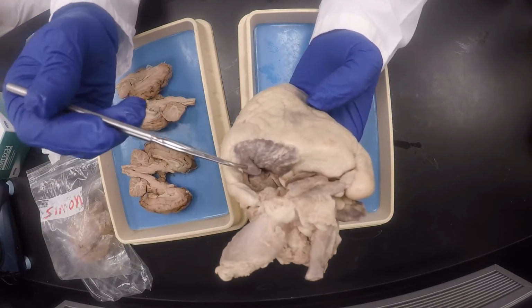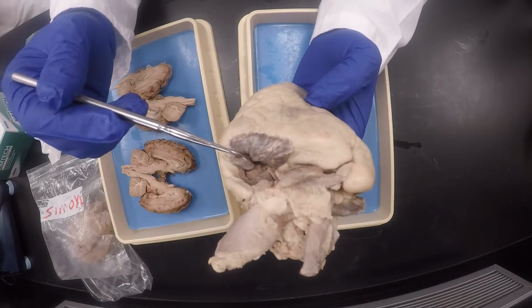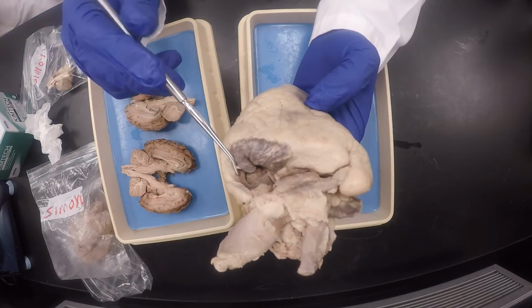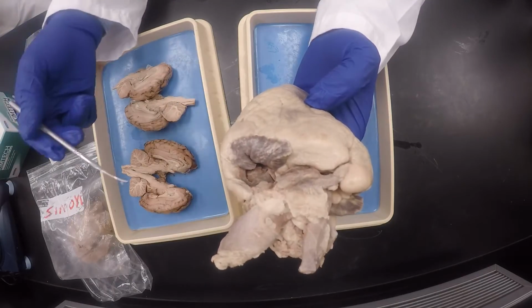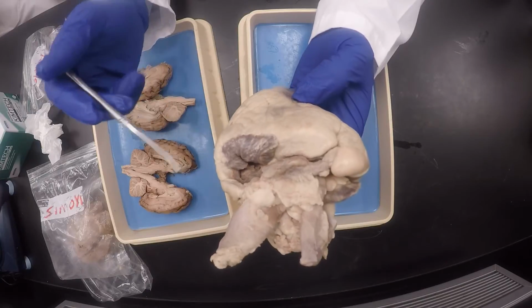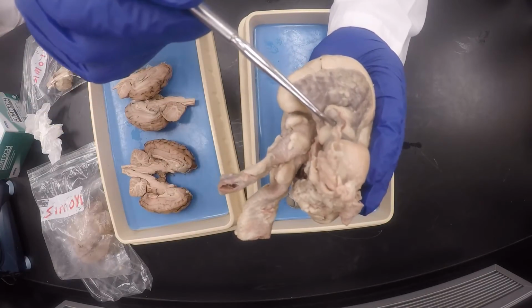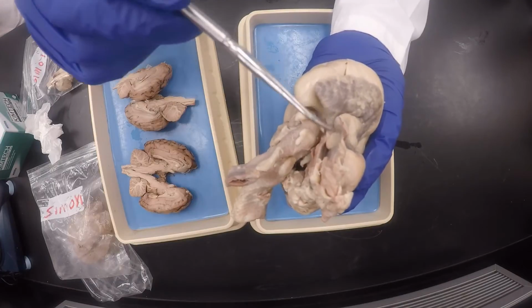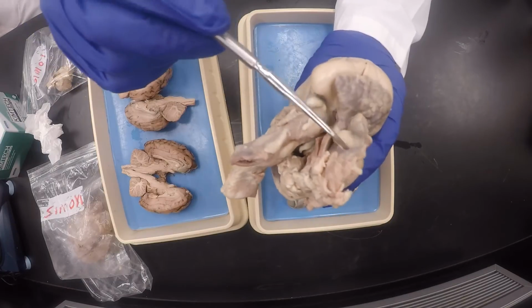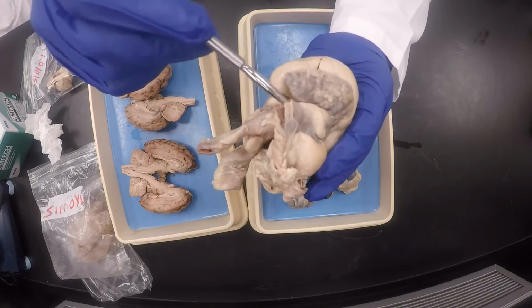Usually, if I put a pin on the left side, on the auricle area there, and I'm asking what's that major blood vessel, you say pulmonary veins, even though you don't see them. Okay, if I'm asking for a blood vessel and it's on the left side, on the left atrium, you say pulmonary veins. Okay, and then on the right side, if I'm asking about a blood vessel, you talk about the vena cava. Don't worry about the superior inferior stuff. This is probably the superior vena cava. Okay, this one right here. But just say vena cava and I'll be good with you.